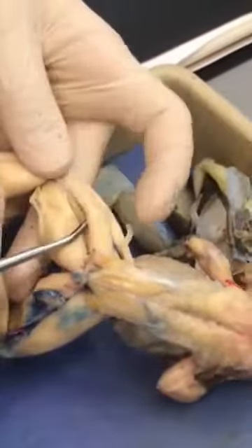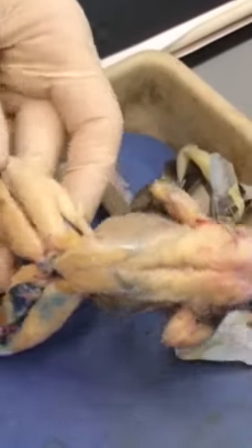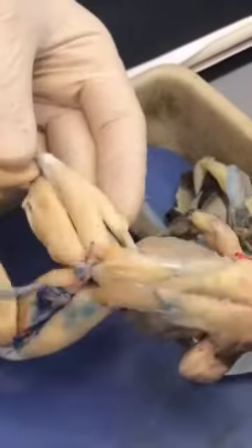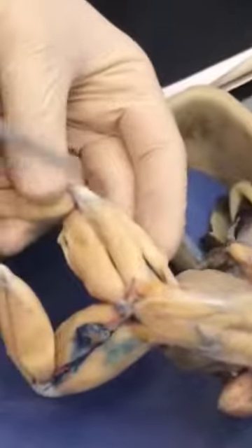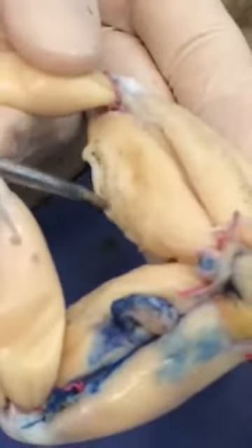The biceps femoris and triceps femoris are the ones over here. This would be triceps, biceps, semimembranosus, and gracilis minor. To recap: triceps femoris, biceps femoris, semimembranosus, and gracilis minor — those are the four external muscles of the leg.